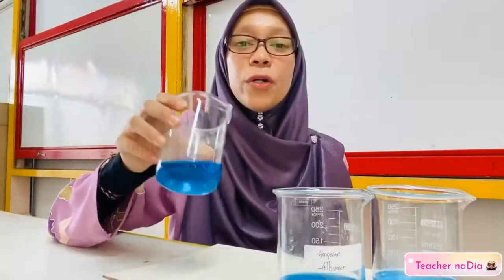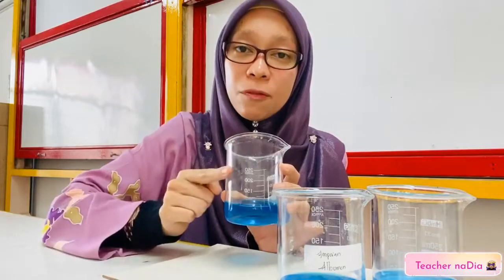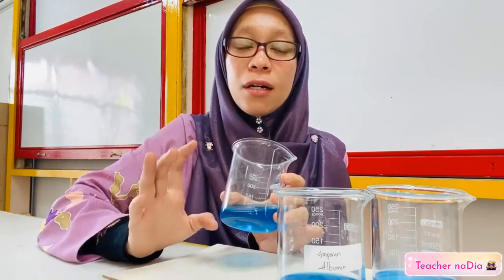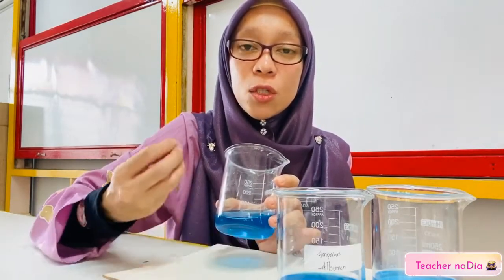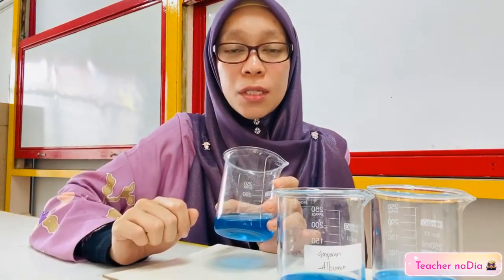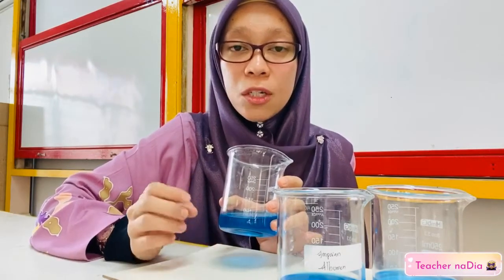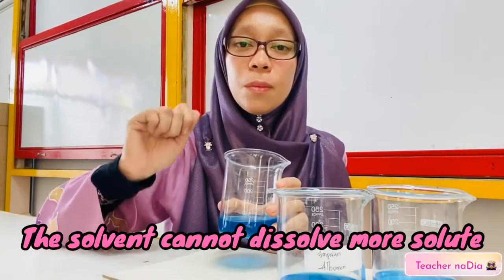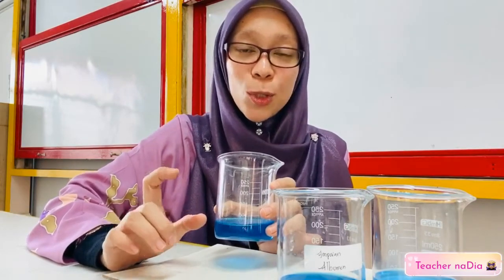For R, why do you think there is a precipitate formed in beaker R? Since we know that R forms a saturated solution, it already has excess solute in the solvent. So even though we keep on stirring, there's still a precipitate formed at the bottom of the beaker because the solvent cannot dissolve more solute. It has become a saturated solution.